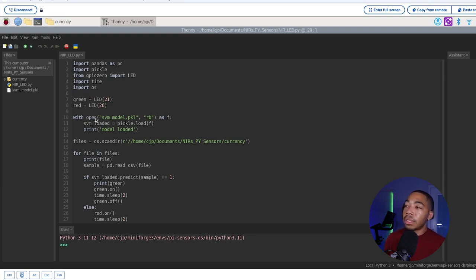Next, I'm going to use the same with open statement I just demonstrated to load my pickled model right into this environment. And then I'm going to create a list of files where I'm going to scan my currency folder where I've already brought over some of my representative files from both NIR materials and potentially anomalous materials or those currencies from around the world.